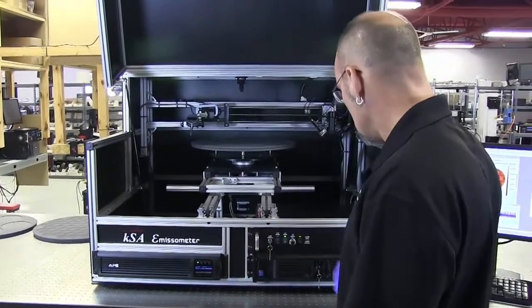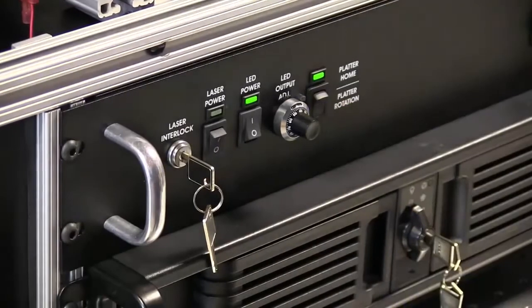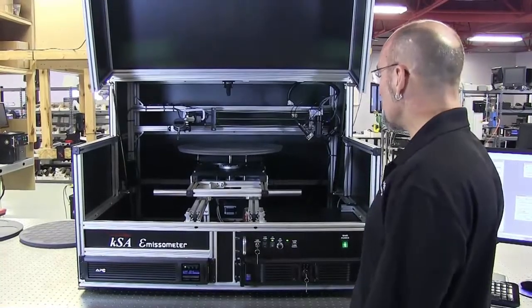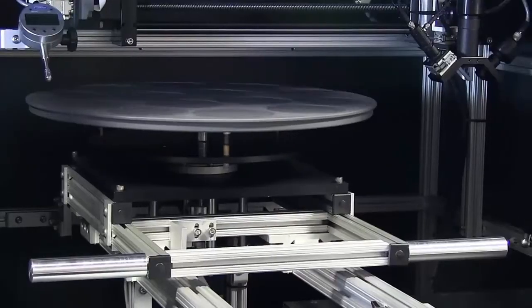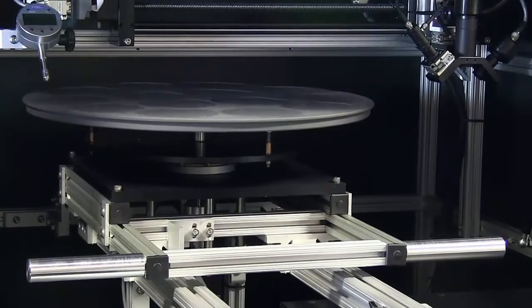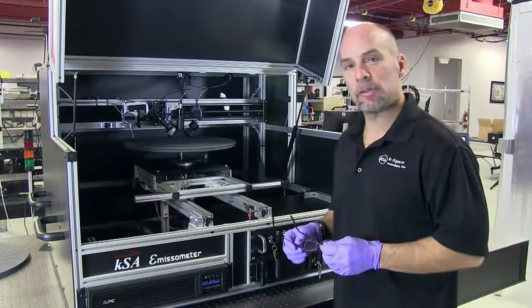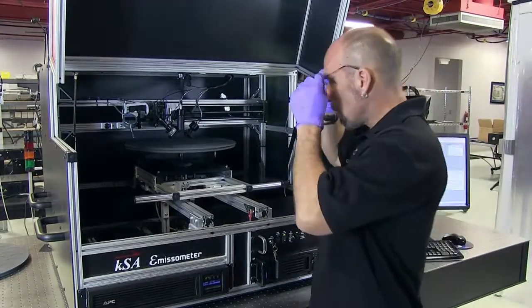We push the platter rotation button and the tool will slowly spin up to speed. This tool is set to spin at about 110 RPM. Let's go over a little bit of the technology behind this tool.